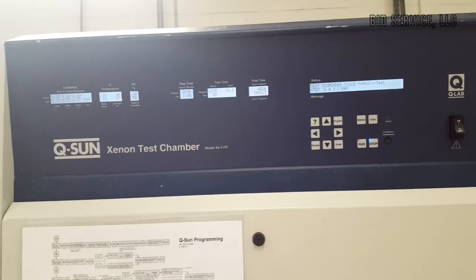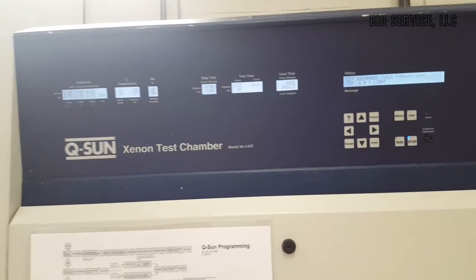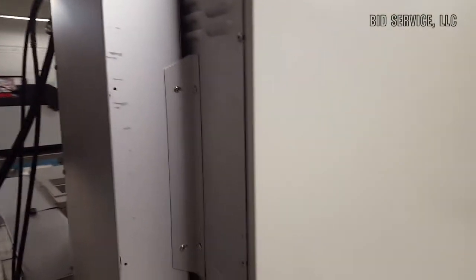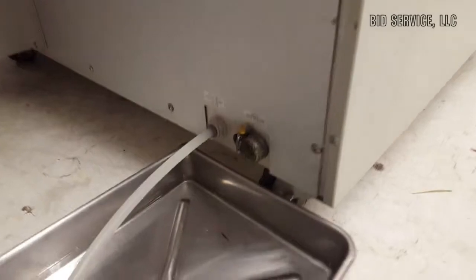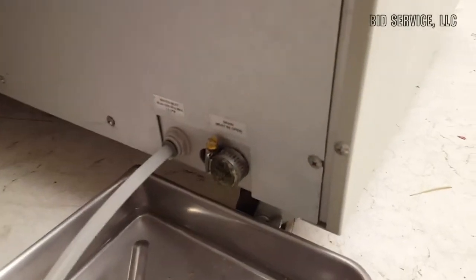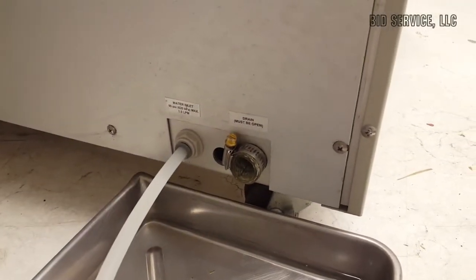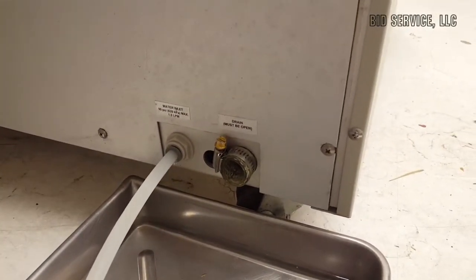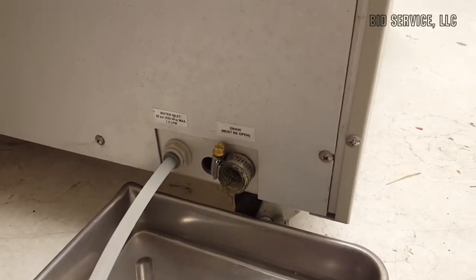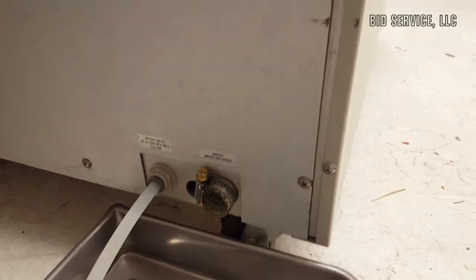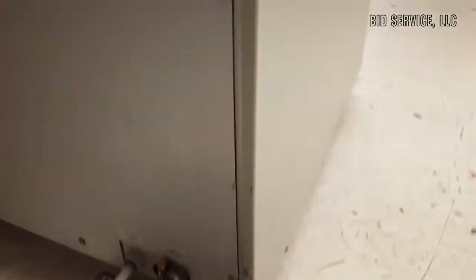Now, we'll step around the back. Just before we start operating it, I'd like to show you that here is where your water supply would be, and a water drain as well. Now, for purposes of our demonstration, we are using a charge bottle here.